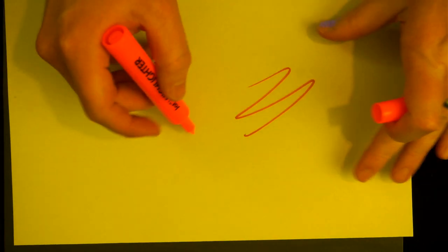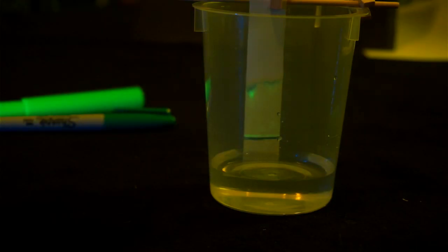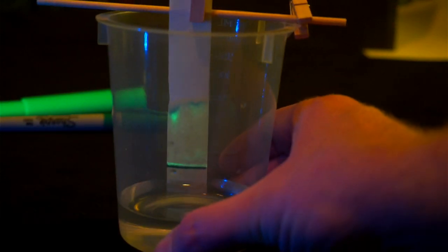If we're using a highlighter, we can use fluorescence. This is a blue LED. I'm going to put a yellow filter on my camera so that you can't really see the blue light. So with the yellow filter on, I'm going to draw some sharpie, which has no fluorescence, no glow. It's not a highlighter type pen. But a similarly colored orange highlighter responds to the now invisible blue light by glowing. We can visualize our separation with that blue light, put on the yellow filter, turn on the blue light, and you can see that the highlighter has moved much faster than the sharpie.